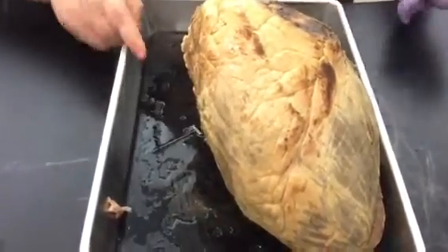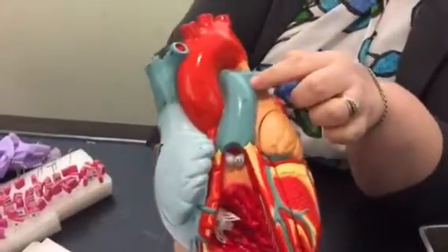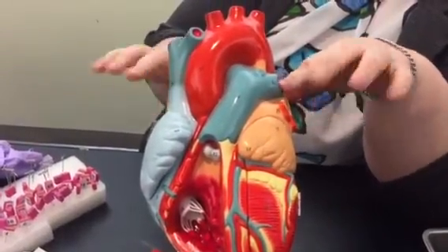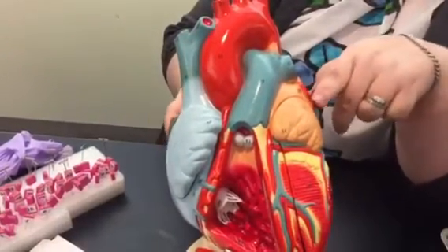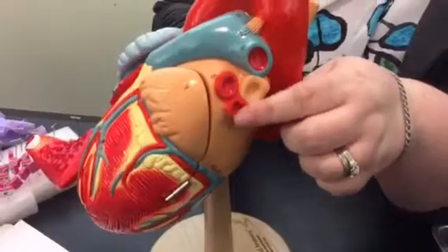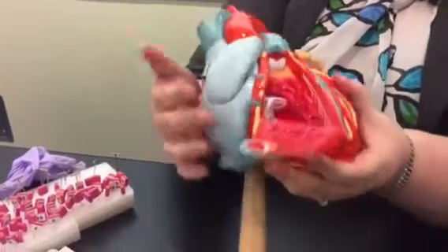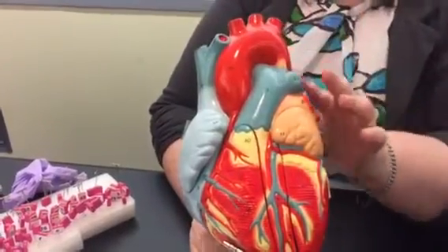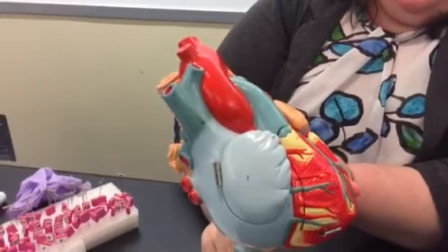I'm going to take my gloves off and do the rest on the model, because we have some little veins and arteries. The pulmonary trunk breaks into the pulmonary arteries. Coming back from the lungs to the heart are the pulmonary veins. We have the superior vena cava — we see that in the cat — and at the bottom you can see the inferior vena cava going down. Aorta, aortic arch, brachiocephalic artery.